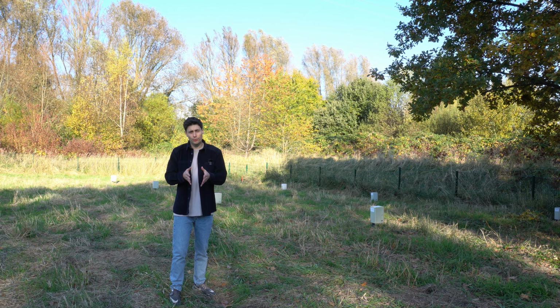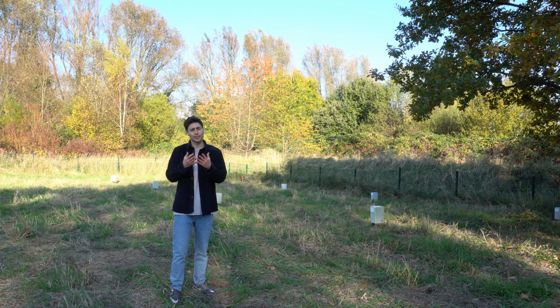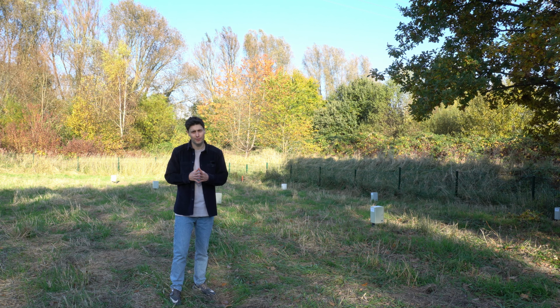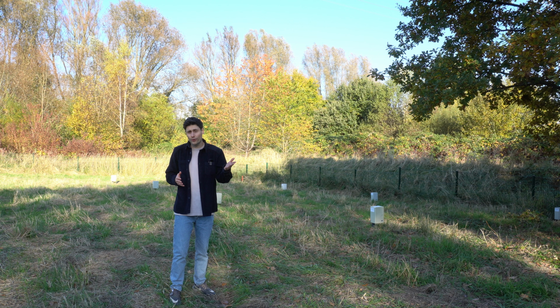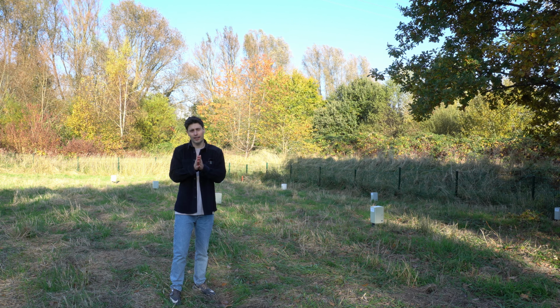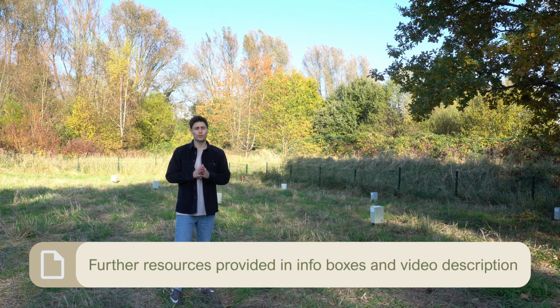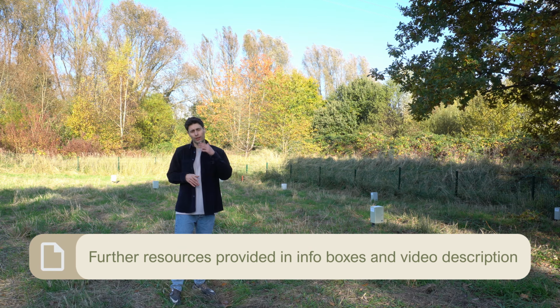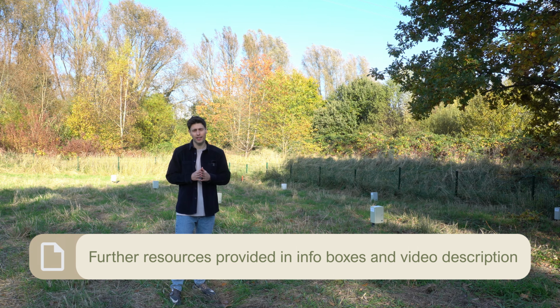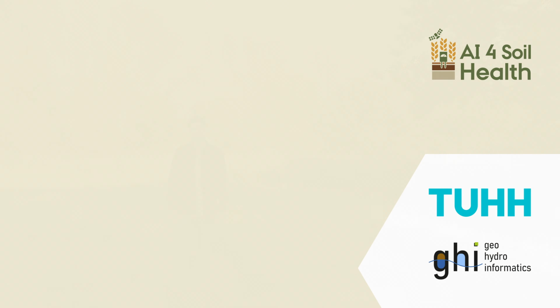In this introduction, we will explain the basics and show you how to sample topsoil in a depth of up to 20 centimeters. However, your requirements may be different and every soil sampling project can have very specific requirements. To guide you toward the optimal solution for your particular project, we will therefore mention literature, international standards and further resources that you can use as a reference.